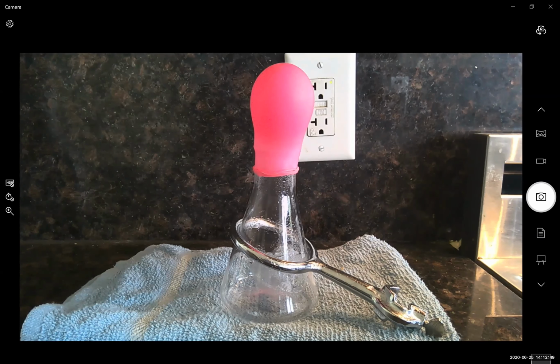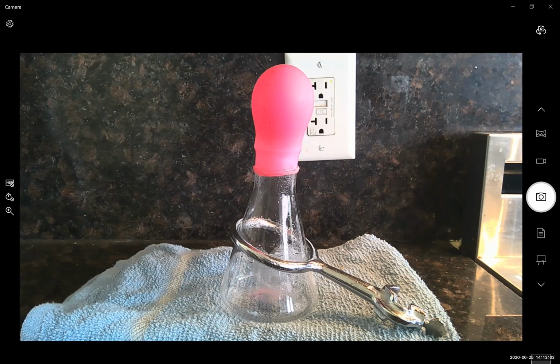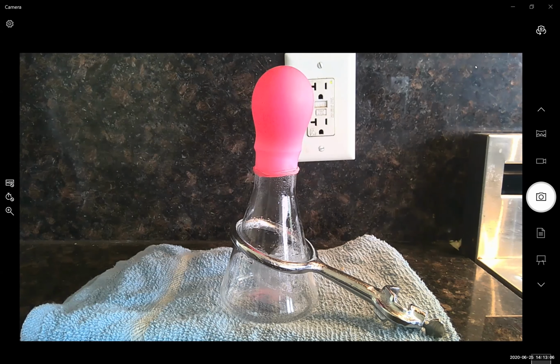So we're going to let this sample sit for about 10 minutes, and then we'll record our results at the end of these 10 minutes. So we'll resume once our sample has cooled to room temperature. Note at this time, just record your observations about the volume of gas in the balloon at a high temperature, and then we're going to compare it to the volume of gas in our balloon at low temperatures. Okay, so we'll resume once this has cooled.